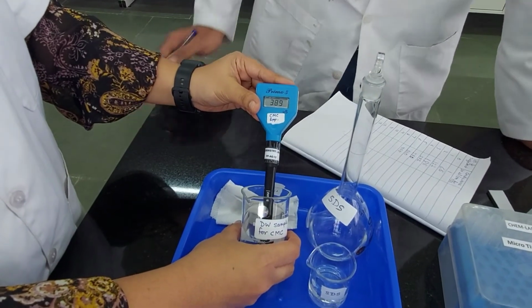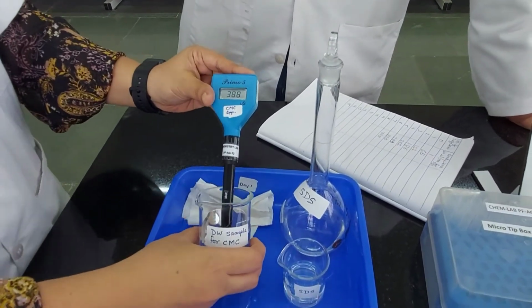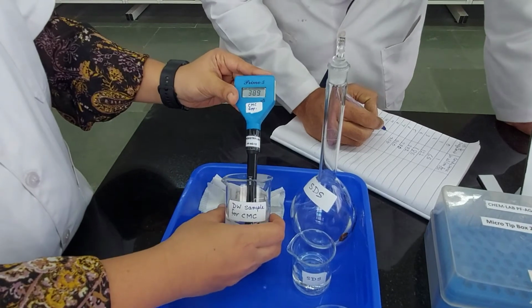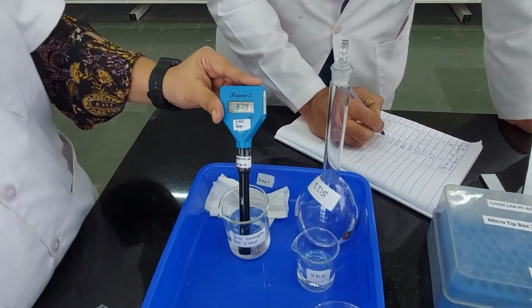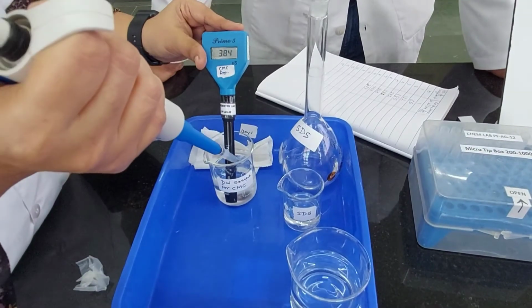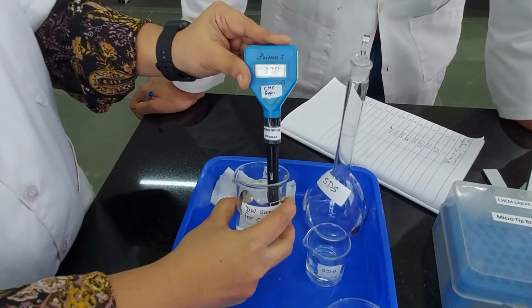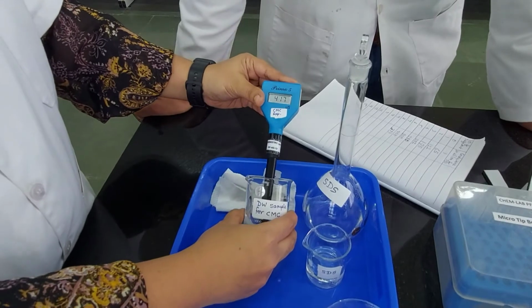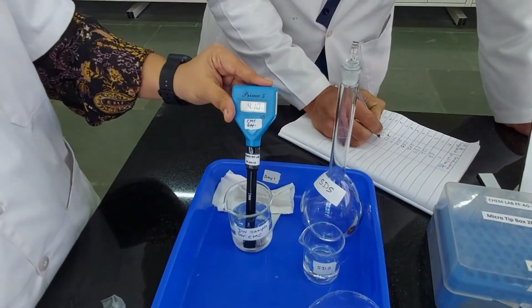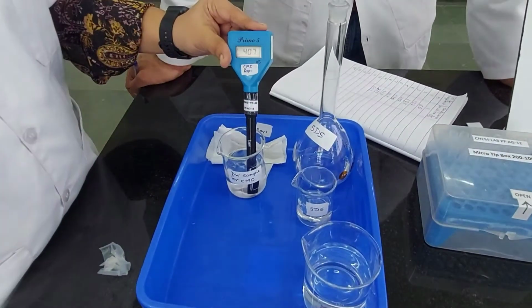Okay. Yeah, it is stabilizing a bit at 389. You have to allow the system to stabilize because it fluctuates. Anyway, I'm making a note of 389. Okay, there it goes, and in goes the next ml. All right, mix it a bit, and the value is 422. Okay, so it is slowly rising now. Initially it was big jumps, now it is slowly rising.